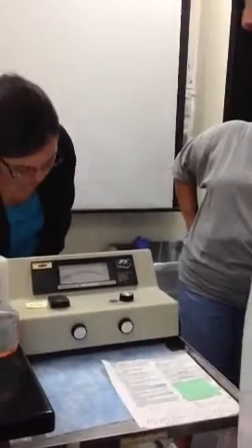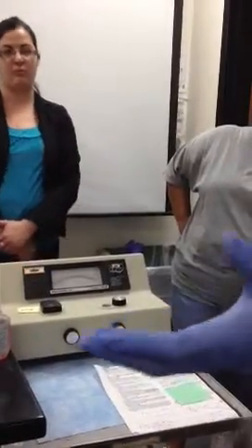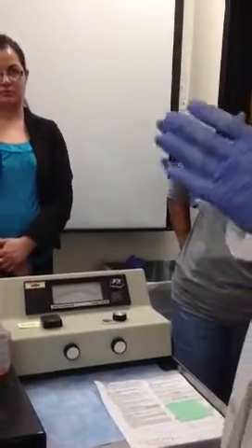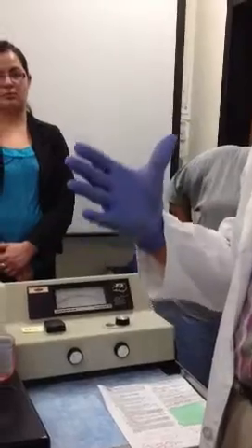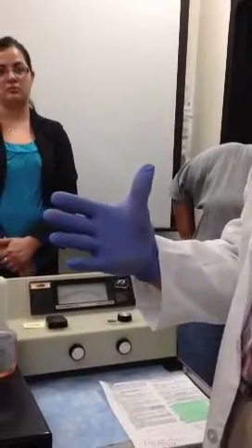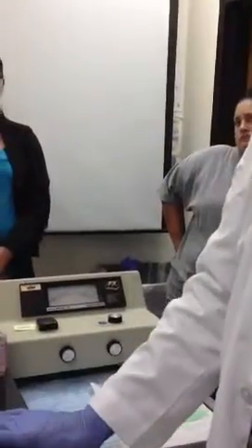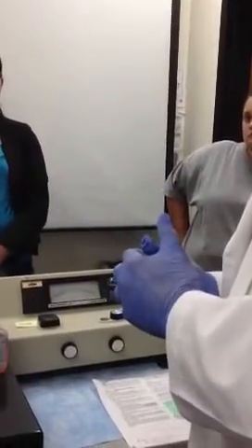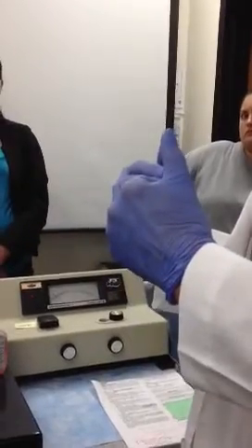All right. So what was our first number? 0.48. This is now 0.98. So what do we know already about the patient's cholesterol relative to our standard? Is it too high? It's higher, isn't it? Because the number we just read is significantly higher than the first number we read. So it's a ratio, isn't it?